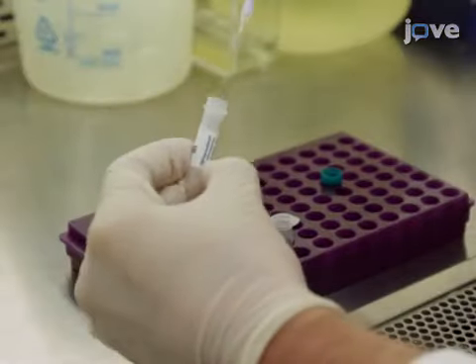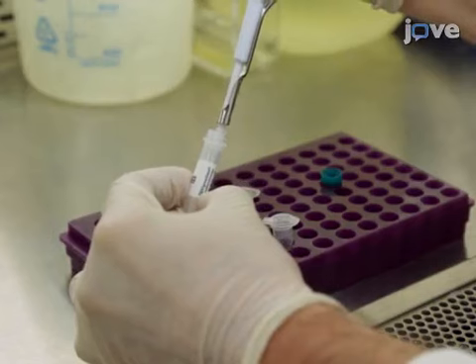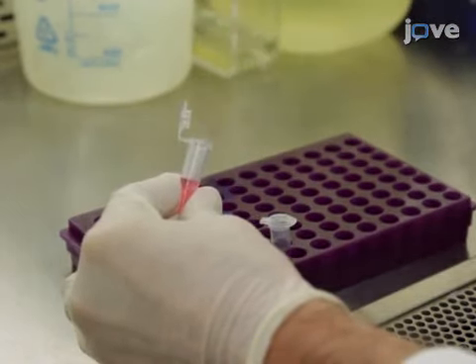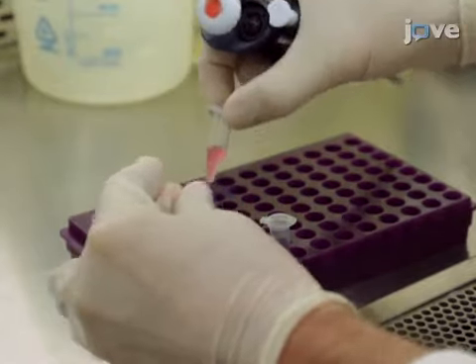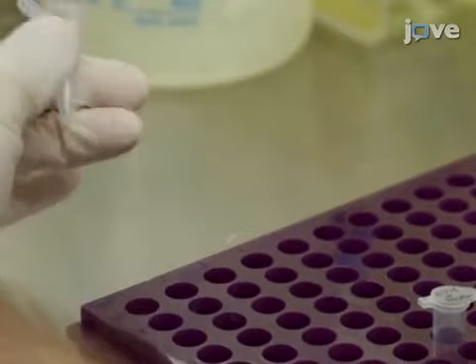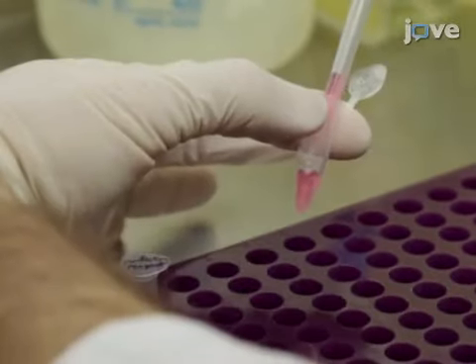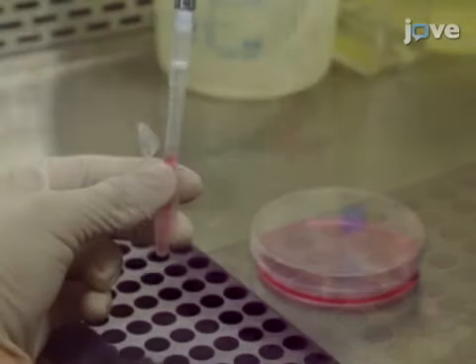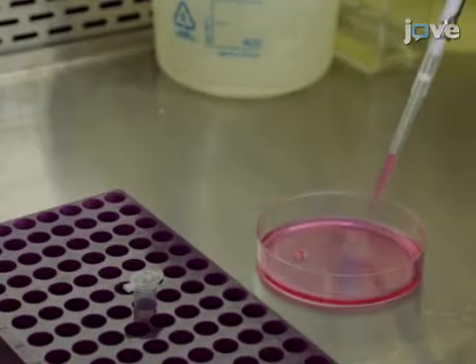The next day, use commercially available transfection reagents, or calcium phosphate, to transfect the cells with 10 micrograms of plasmid carrying full-length retroviral molecular clones, or 9 micrograms of envelope-deleted single-round vectors, plus 1 microgram of a VSV-G expression construct. Add the mixture to the cell media dropwise.